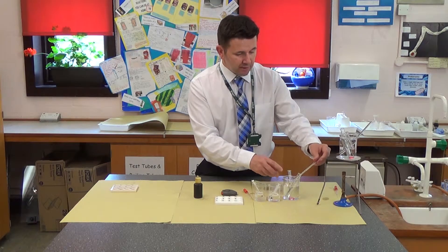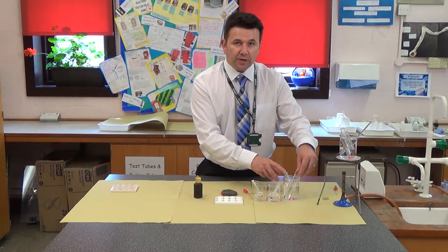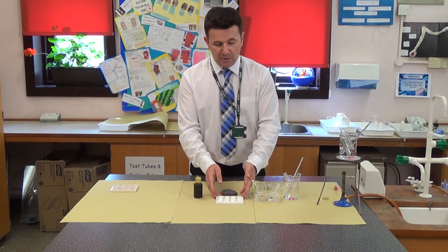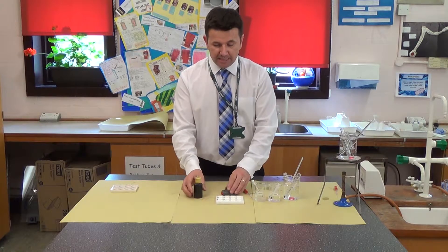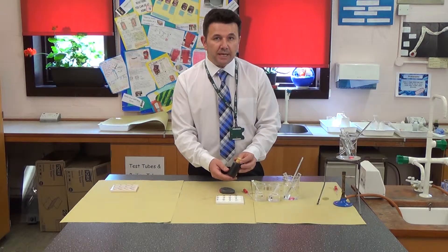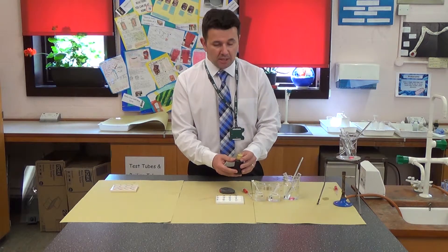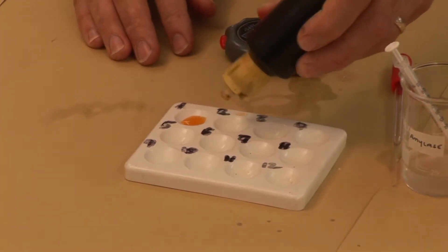Looking at the thermometer, it reads 22 degrees Celsius. I make sure that I note down the temperature, then I set up the actual experiment. We have a spotting tile, and I'm going to add iodine to it. Iodine is a brown substance, and if starch is present it goes black. So it should be a brown substance here.